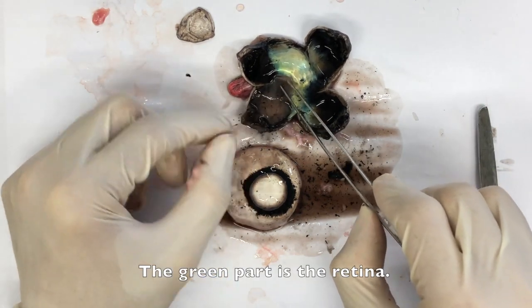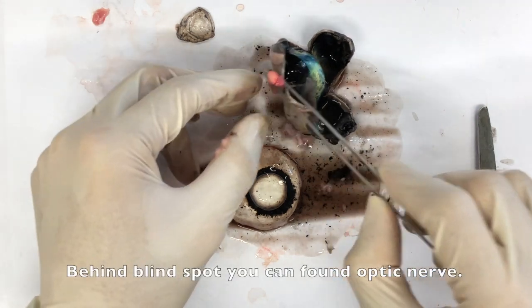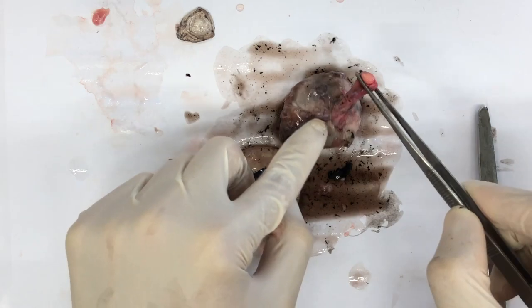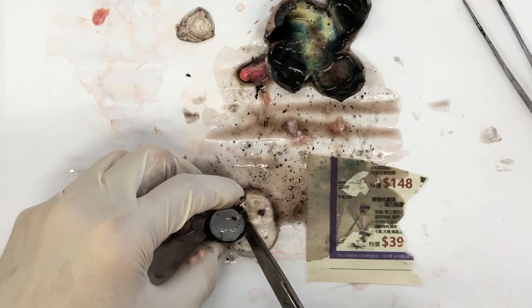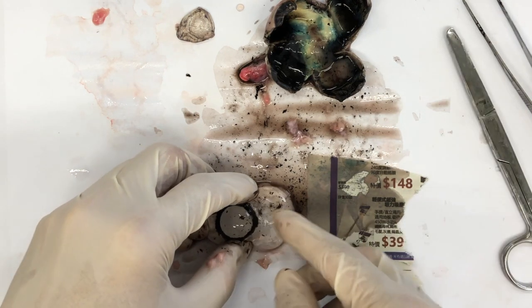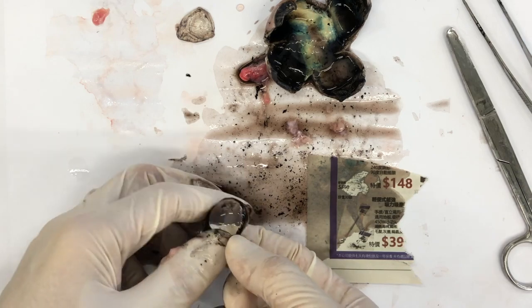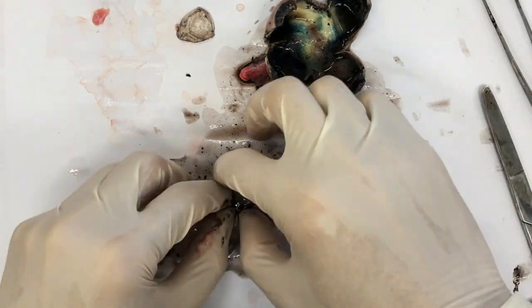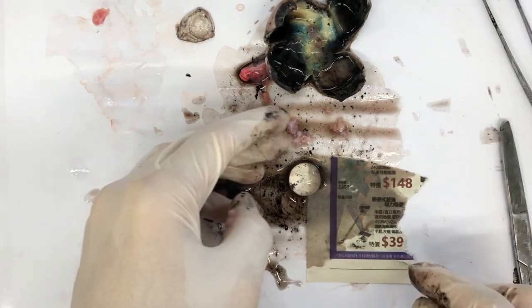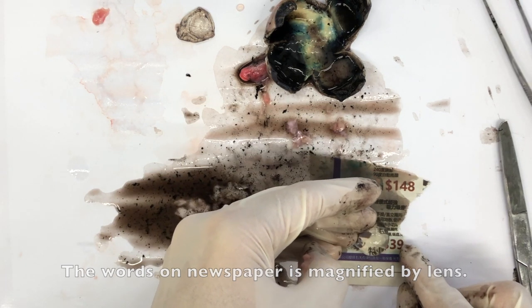And what we see here is the retina. And now I'm pointing to the blind spot. You can see that the blind spot is linked with the optic nerve. And now we want to separate the lens from the jelly-like fluid. When you put the lens on the newspaper, you can see that the words are magnified.